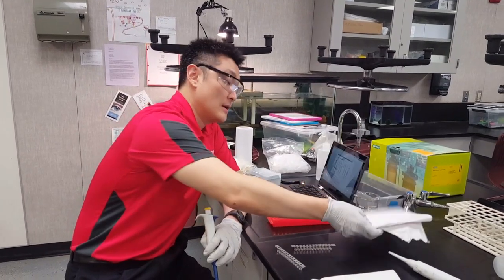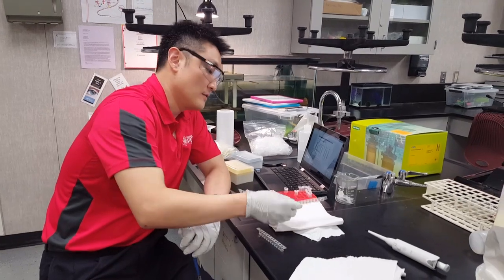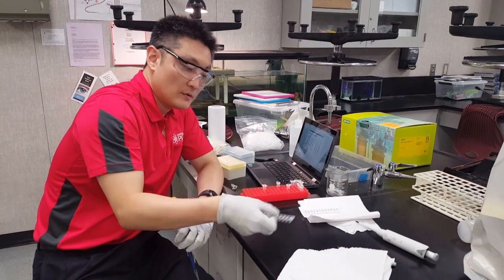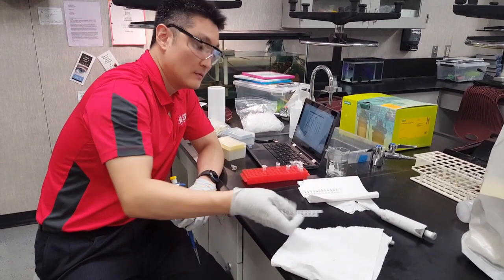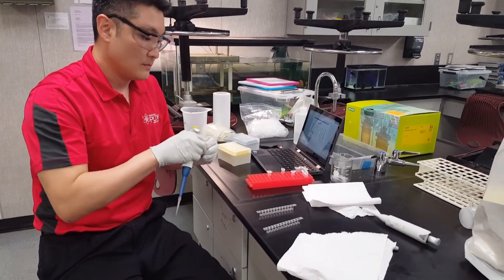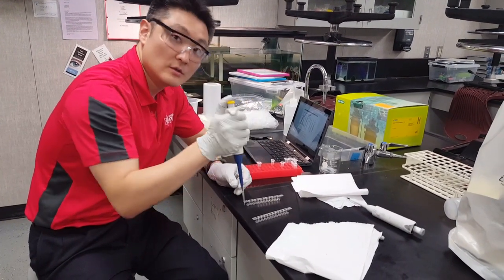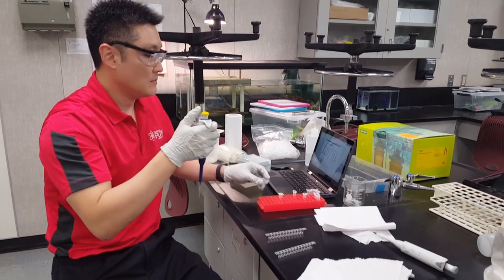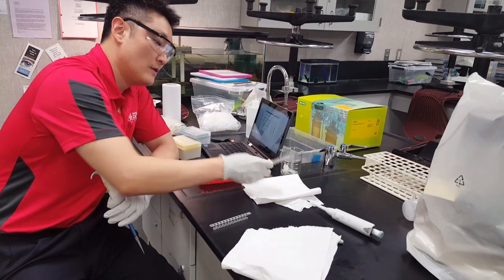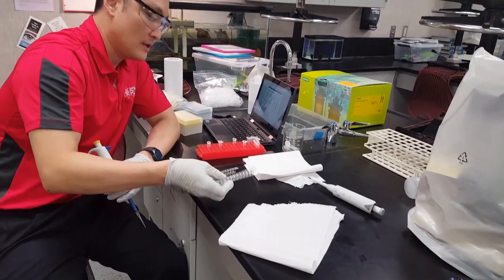Get a new set of paper towels and invert the strips 5 times to remove the wash buffer — 1, 2, 3, 4, 5 — for both strips. Then add the wash buffer again: 100 microliters to every single well. Invert 5 times again to get all the wash buffer out, for both strips.